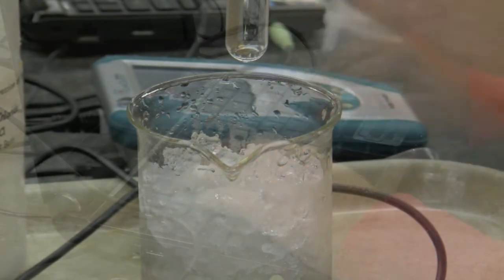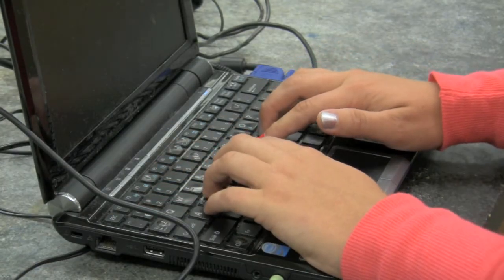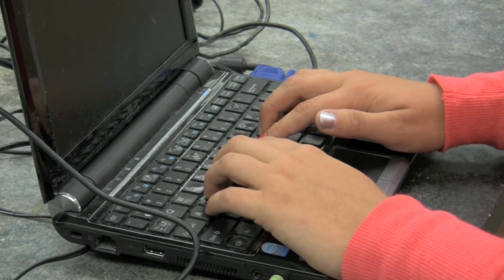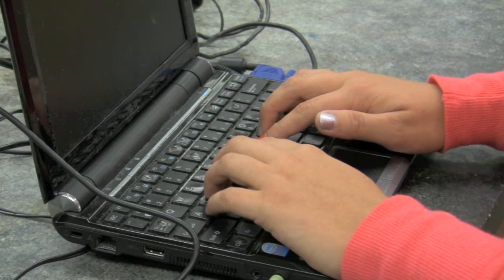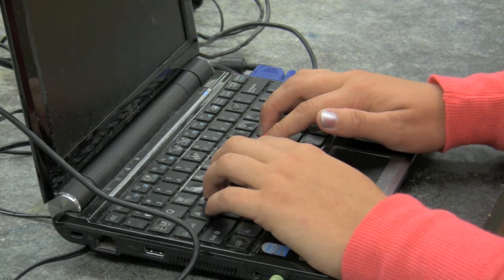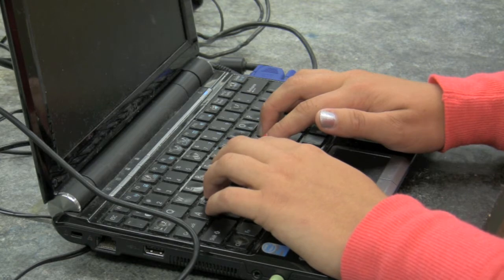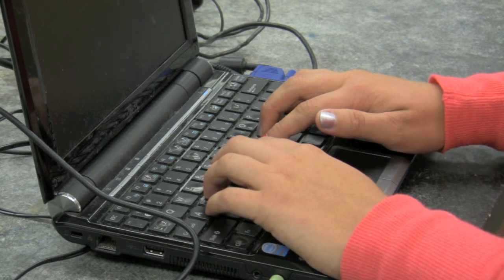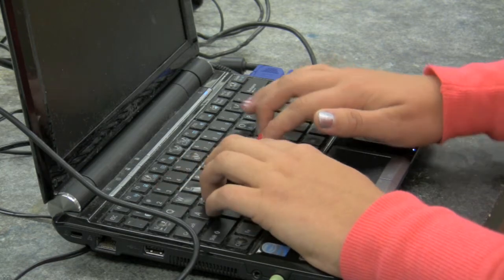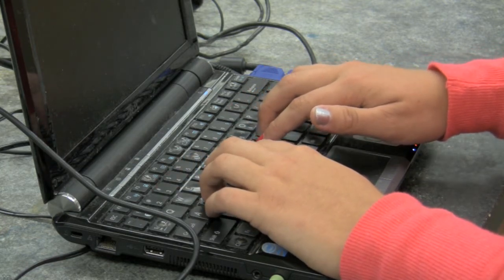She is now setting up Logger Pro to record temperature. JAWS automatically announces a temperature dialogue prompt: 'Please enter in seconds how often to announce this sensor reading. Seconds may contain one decimal place, e.g. 2.5 for every two and a half seconds.' The student enters 3.0 seconds. The system confirms: 'Automatic announcement of sensor one activated.'